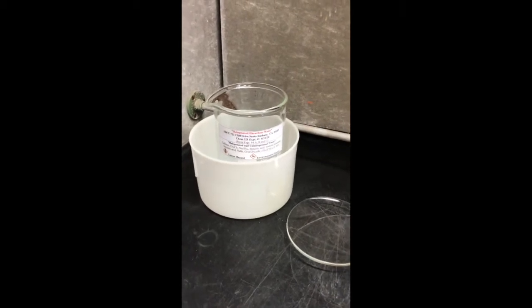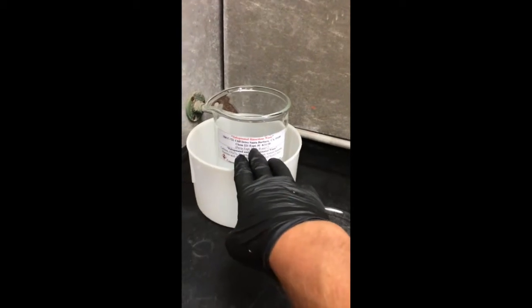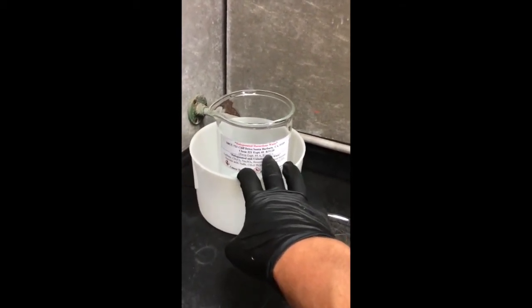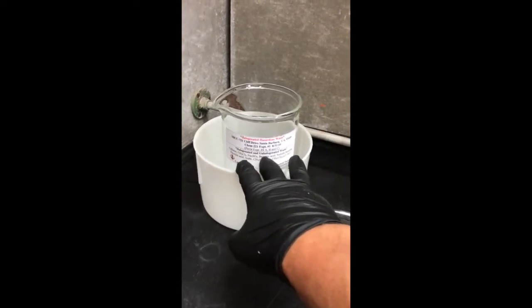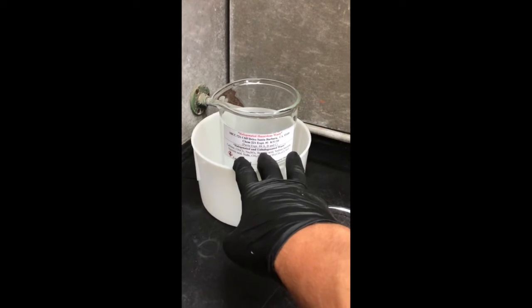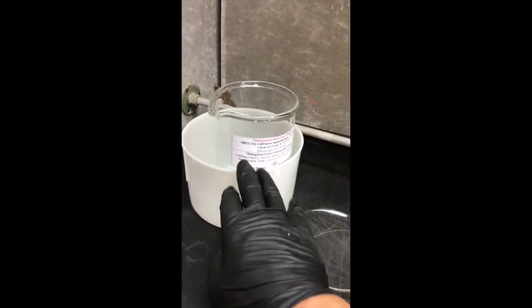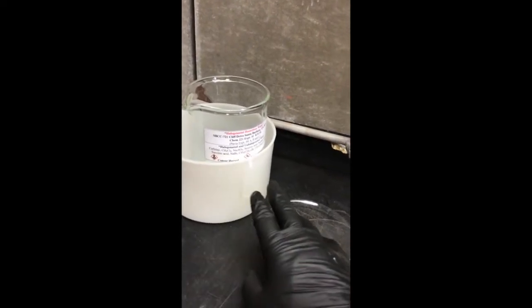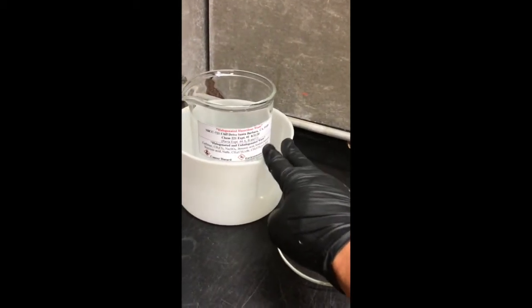And then anytime you're throwing something in that waste, you want to make sure that it's very specific, and it says, for example, experiment 1, and then what's the date that we're running this, or the halogenated and unhalogenated waste. We want to make sure whatever you're throwing in here is on the list of chemicals that's on this waste label.